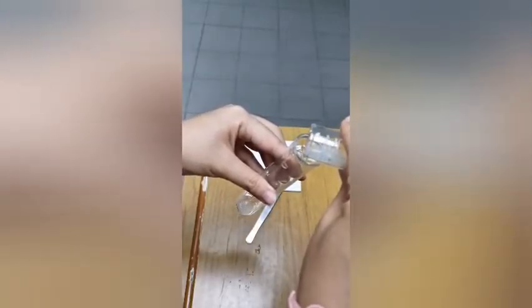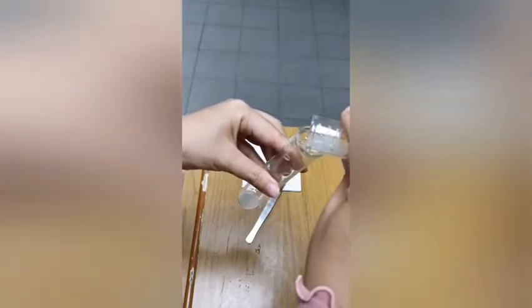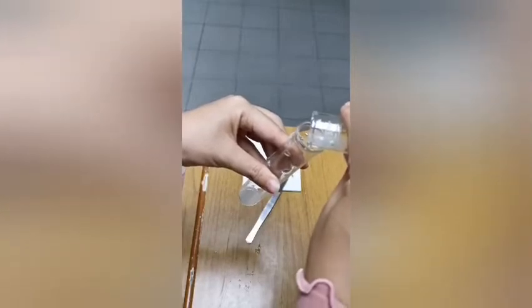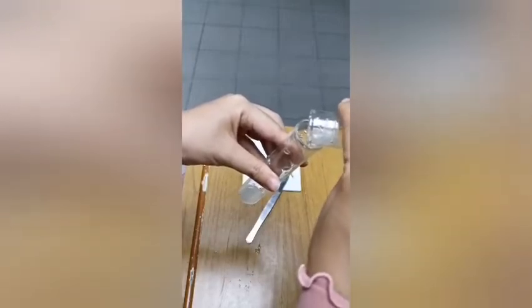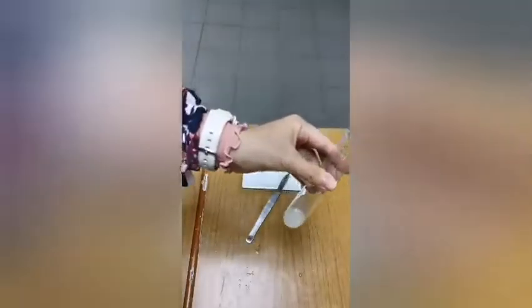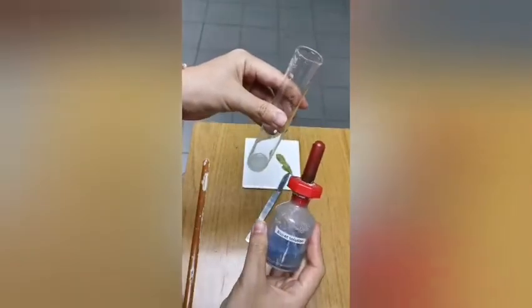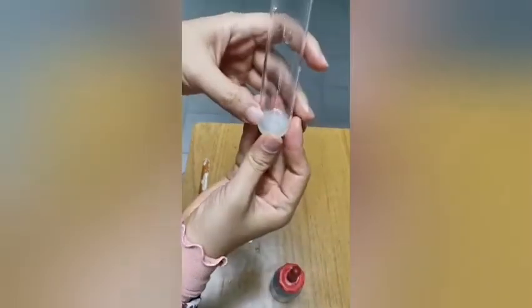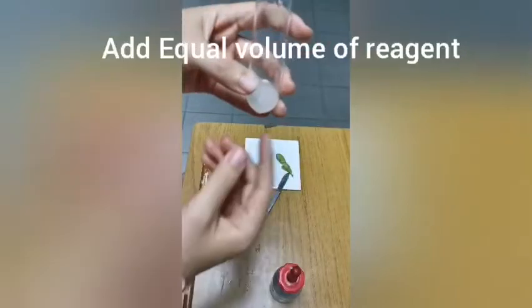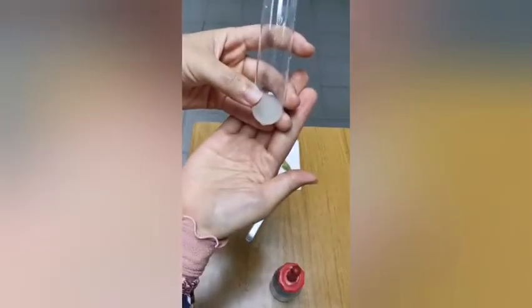Trying not to get any solid food specimens into the test tube, but if you do get 1 or 2 pieces, don't worry about it. You just don't want the bulk of it to enter my test tube. So the test for proteins uses biuret solution. You want to add about equal volume. Normally I just place my thumb, and add about double of that.